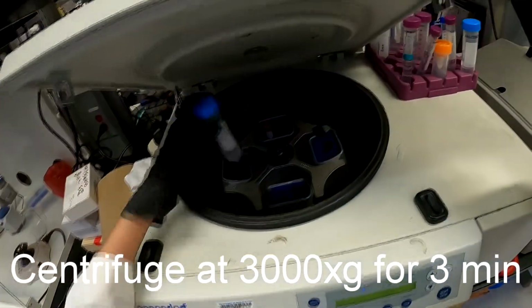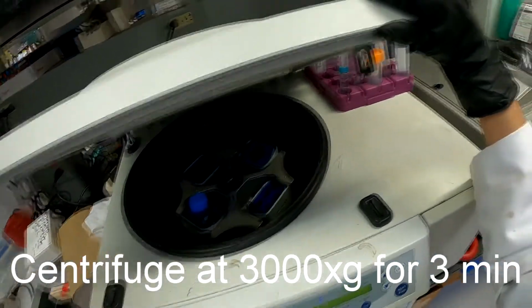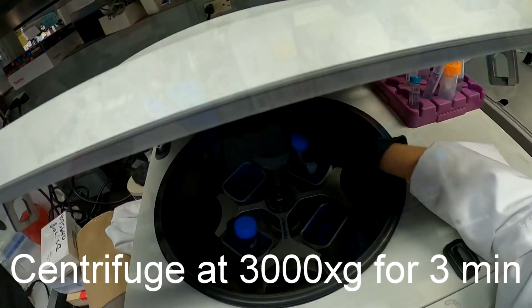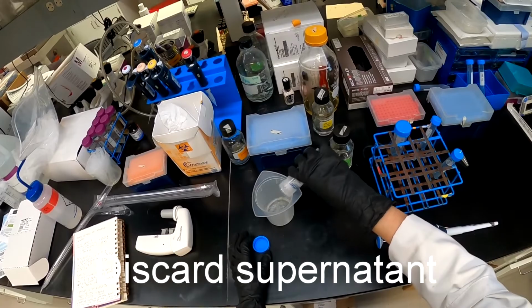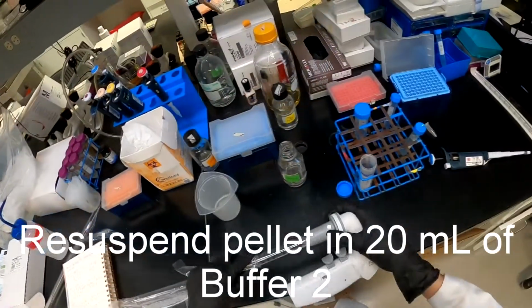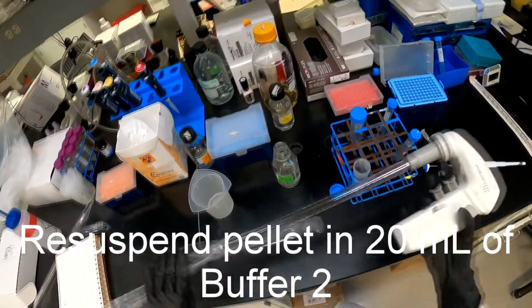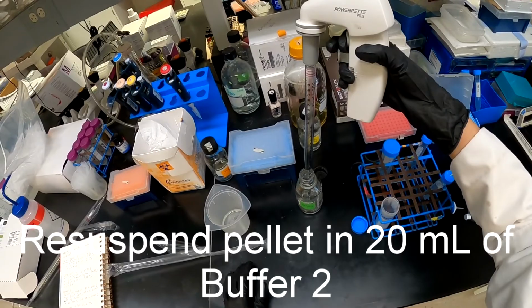The cells were then pelleted by centrifugation at 3000 G for 3 minutes at room temperature, followed by a removal of the supernatant. The cells were then resuspended in 20 mL of buffer 2, which consisted of sorbitol, potassium phosphate, and magnesium chloride.